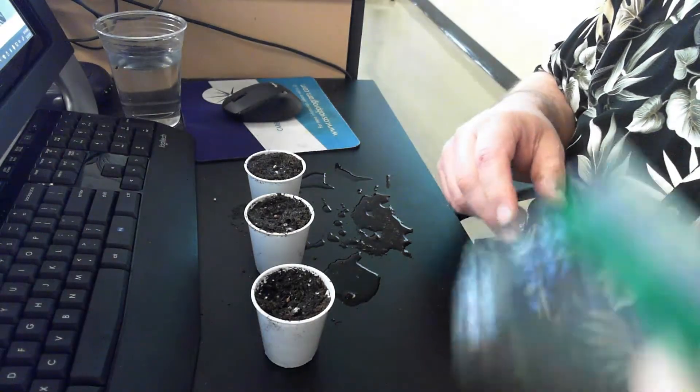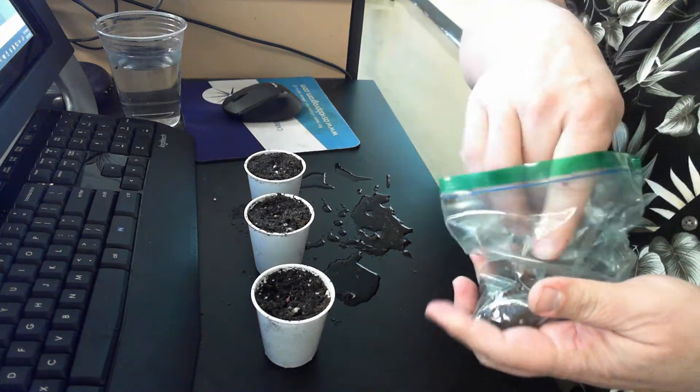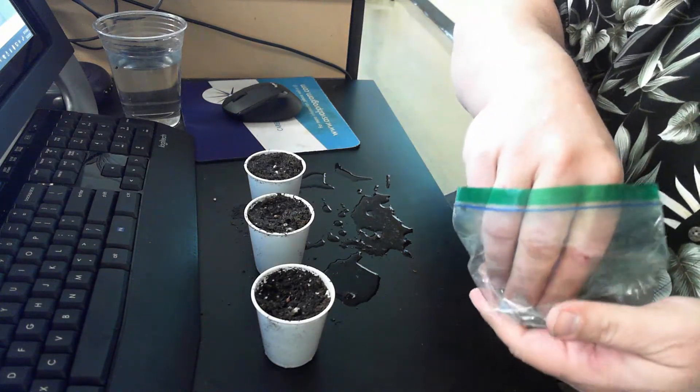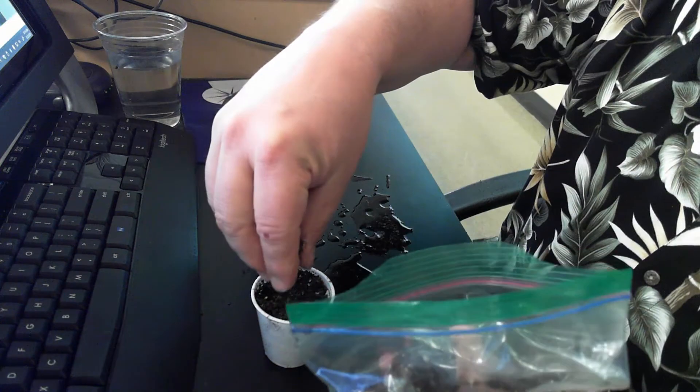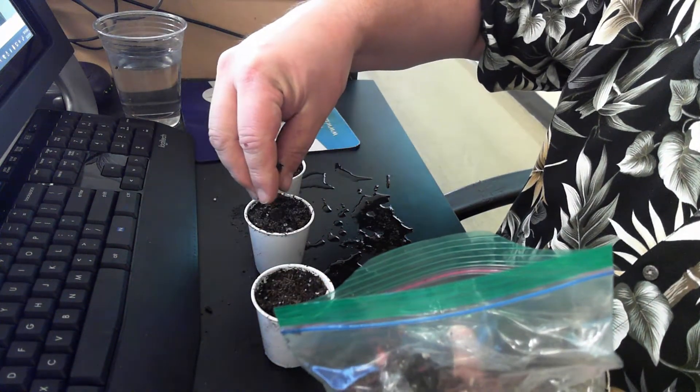I'm going to get a little bit more of my dirt. I do not want to pack these down and bury them. I do want the seeds to be covered.